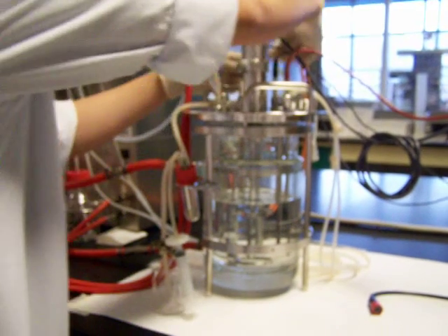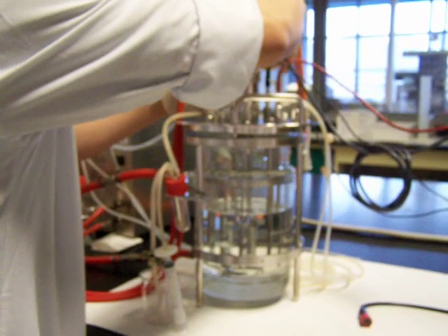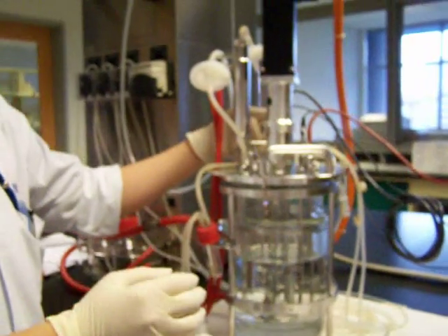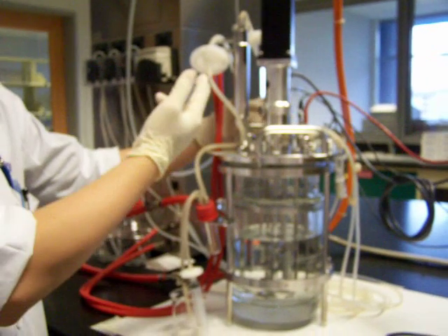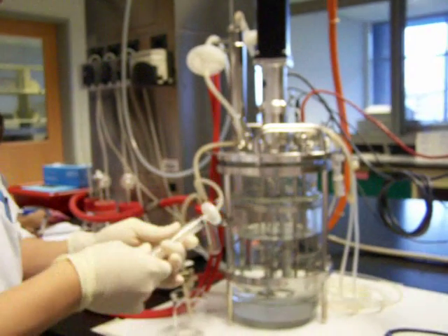So first step, we will loosen the clamp at the inlet and withdraw your syringe.